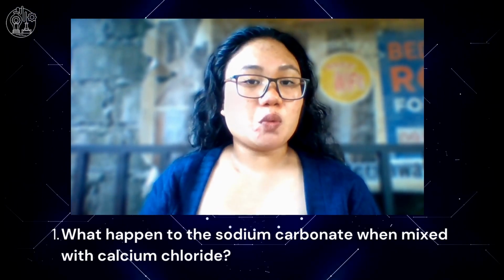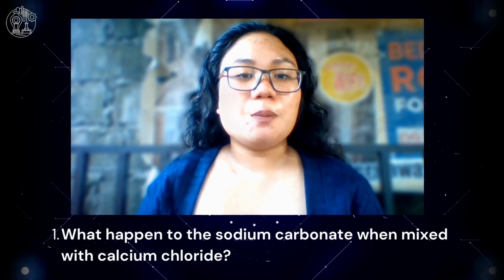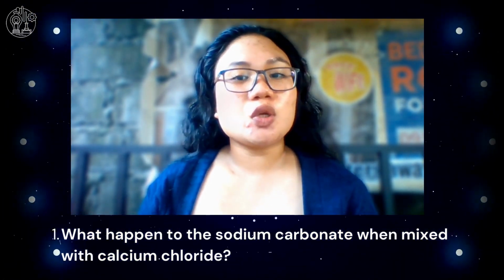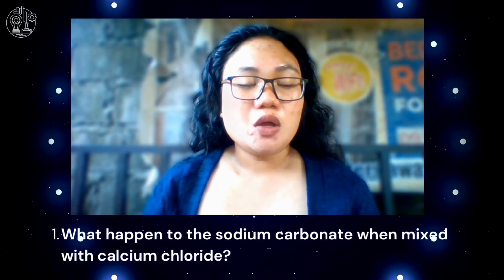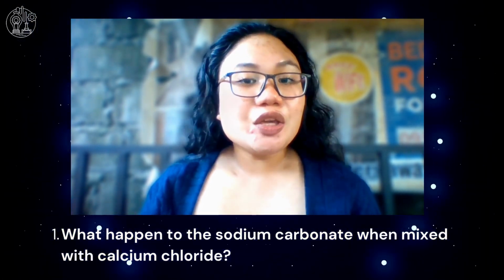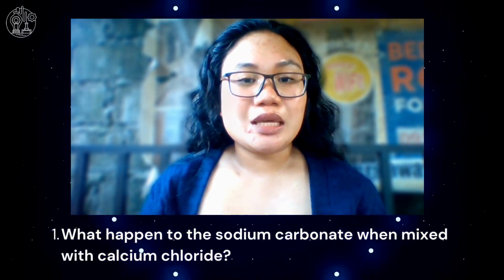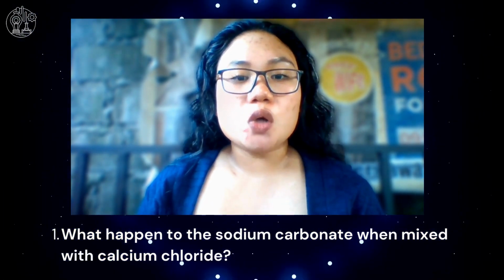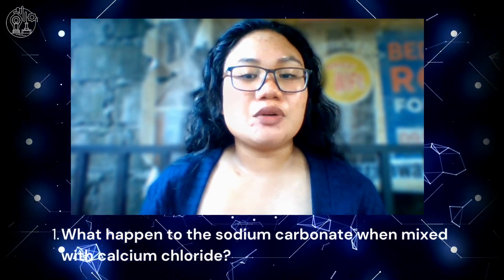In question number 1, what happened when the sodium carbonate solution mixed with the calcium chloride? The answer is, when the solution of sodium carbonate is mixed with the solution of calcium chloride, we have a double displacement reaction. The ions in the two solutions switch partners to form new compounds. In this case, the calcium carbonate precipitates out of the solution as a solid, while the sodium chloride remains dissolved.